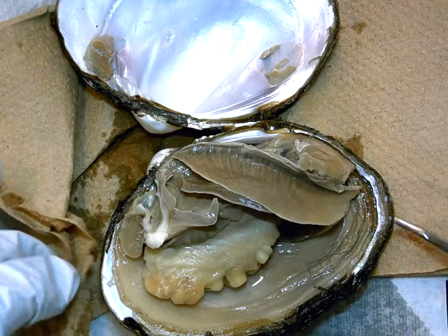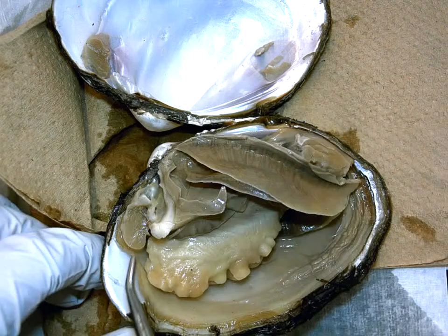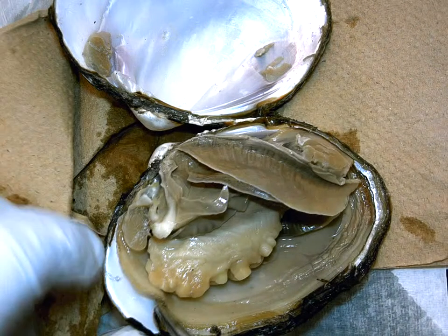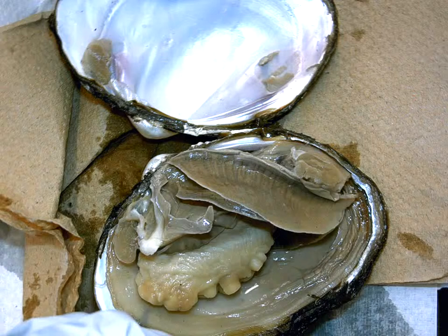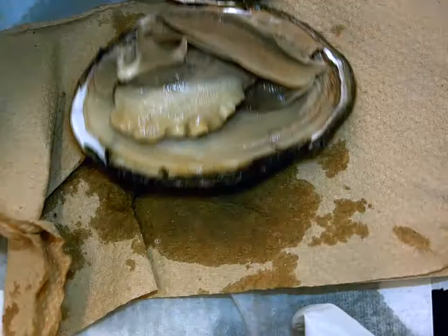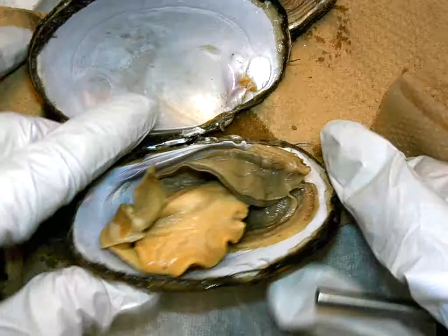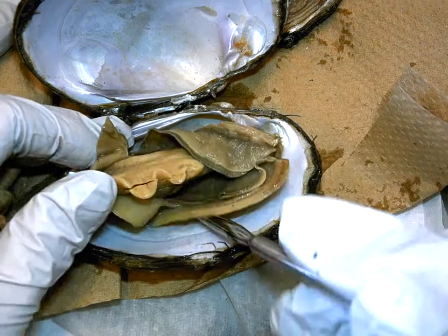It will ask you to remove this thin mantle tissue. You pull the probe underneath the mantle tissue, peel it up, and eventually pull the whole animal out — which I've already done on another specimen, so I'm going to switch specimens now and replace it with an animal whose mantle tissue has already been completely separated.